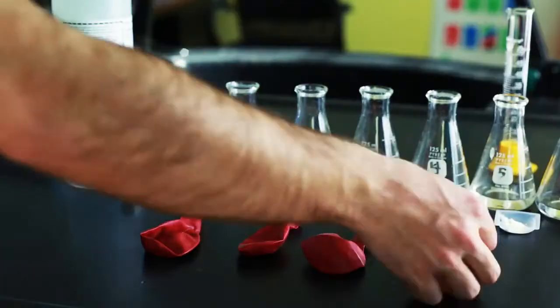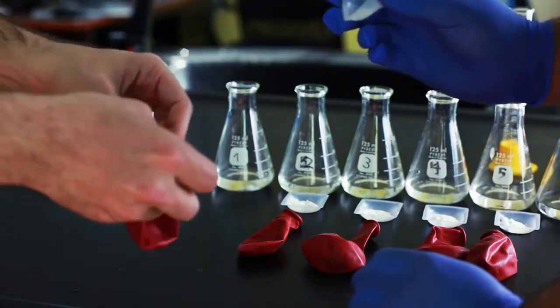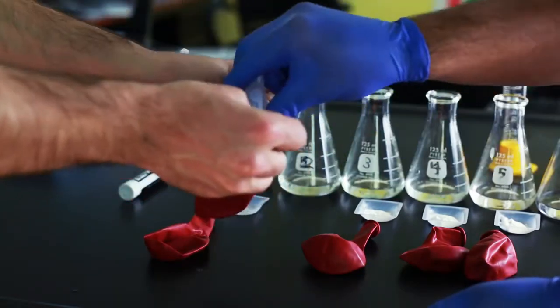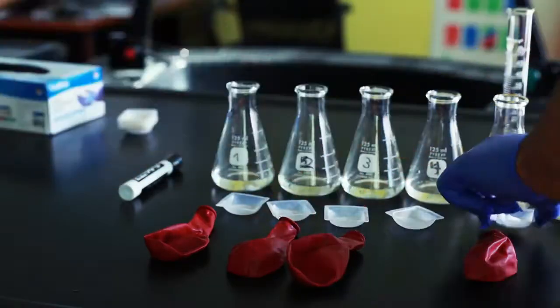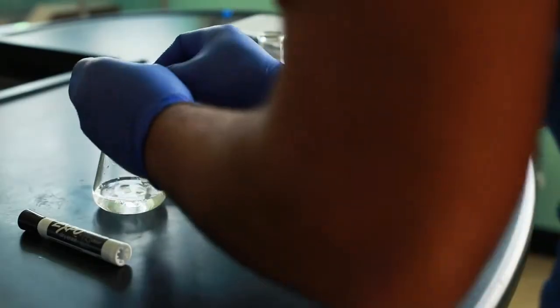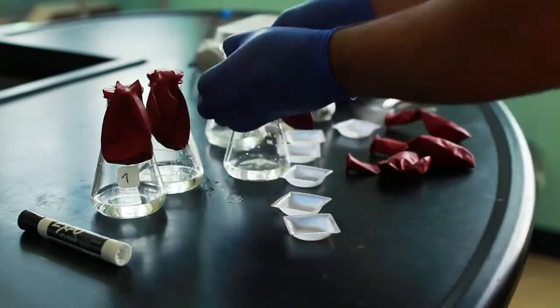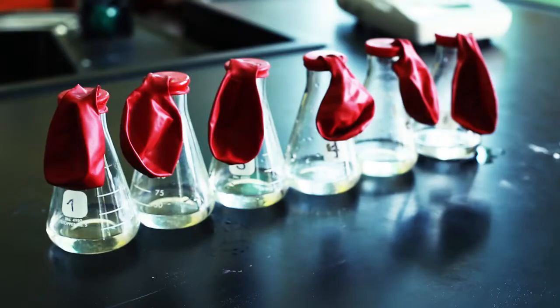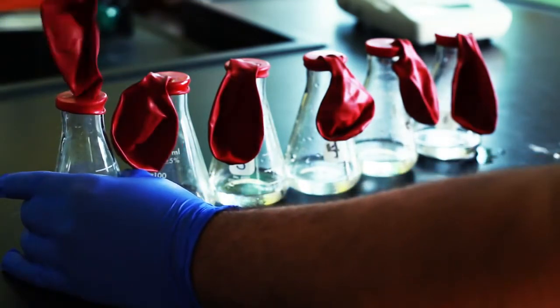My chemistry teacher assisted me in stretching each balloon for easy expansion. I added the contents of the weighing dishes into the balloons by number, then attached each balloon to the corresponding Erlenmeyer flask and let them hang by their side. In the final step, I poured the contents of each balloon into the Erlenmeyer flasks.